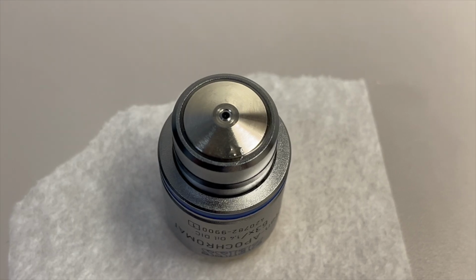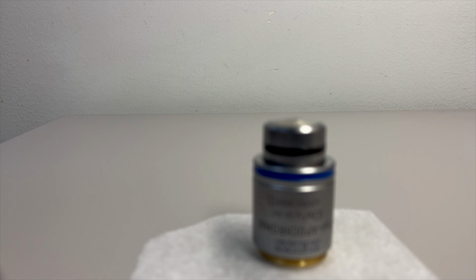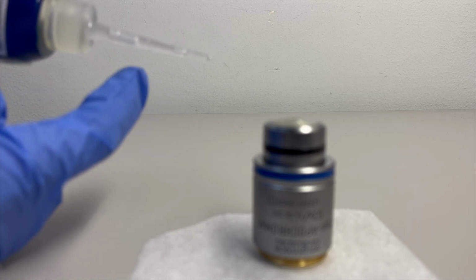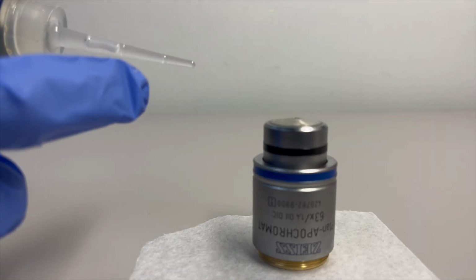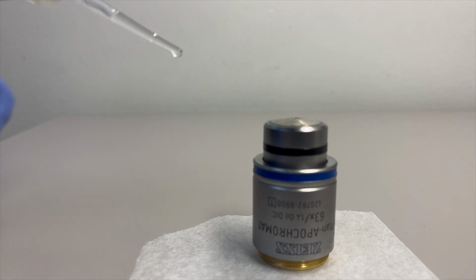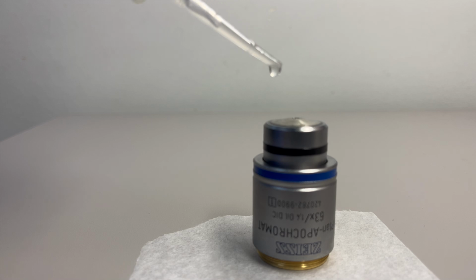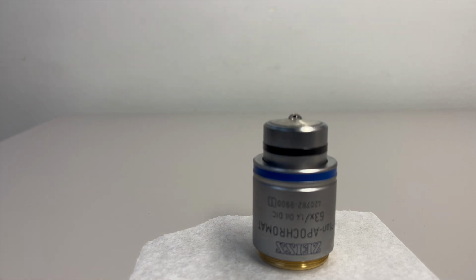Oil is commonly used as an immersion medium, but can be very messy. One way to avoid big oil messes that might obstruct the lens or contaminate other parts of the microscope system is to control your droplet size. In this video, you can see the oil within the nozzle of the oil dispenser. You can also see that, without applying too much pressure to the squeeze bottle, a drop naturally accumulates on the end of the nozzle. Lightly tap this droplet on the objective lens.